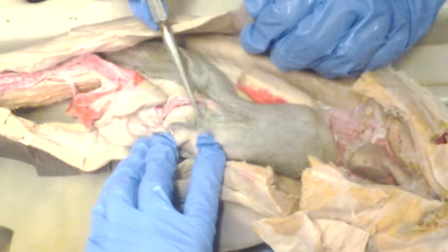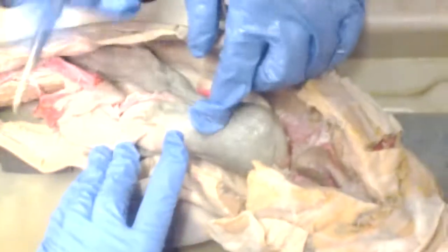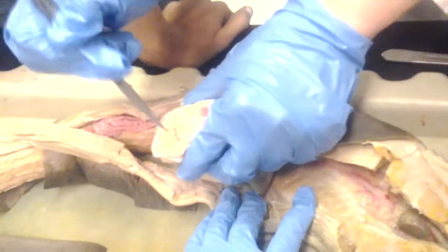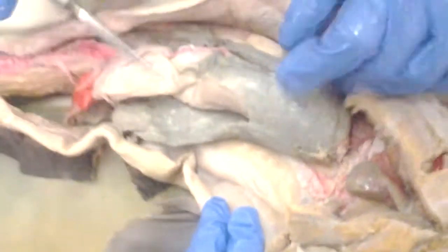So this is the gallbladder, and the esophagus is underneath it, right? Yeah. The esophagus is here. It's cut. Here you can really see the papillae very well. These are esophageal papillae, so I would need to write esophageal. How about that? Left lobe of the liver. I'm just going to squiggle.